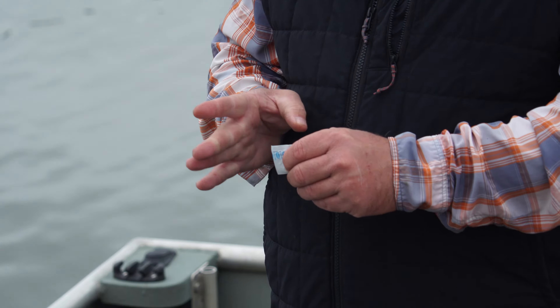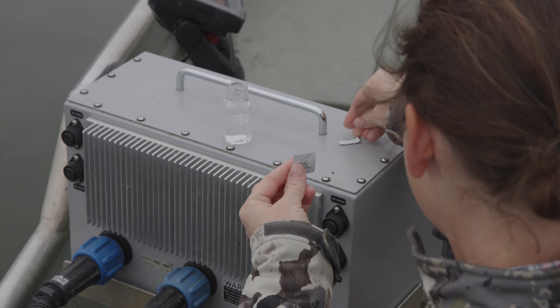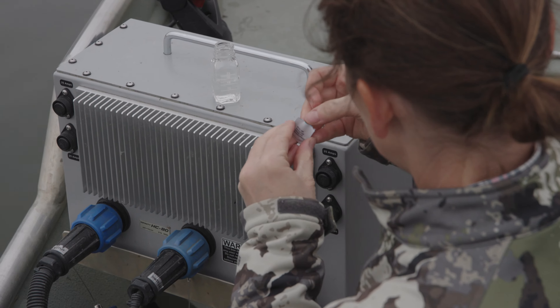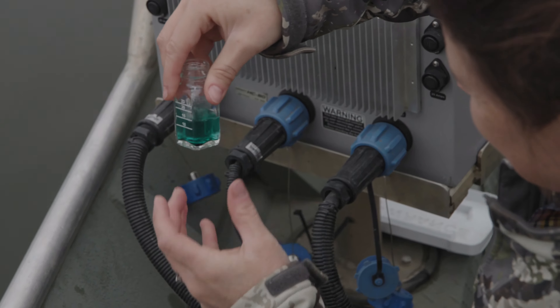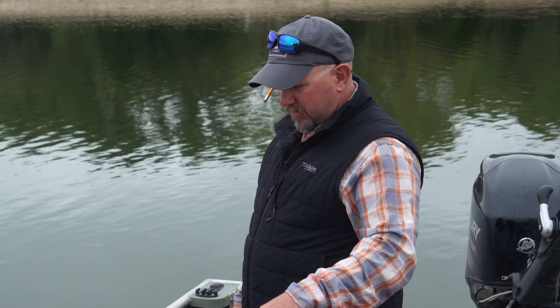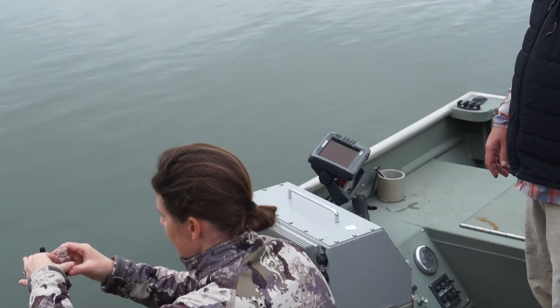Put that in first. The idea is you put it in, you swirl it, and it'll start to flip from green to red. What you're doing is dropping an acid into a buffered solution to see how much buffering capacity is in there, which is alkalinity. She's counting how many drops it takes to start to flip it over to pink. How many up to now? Eight.